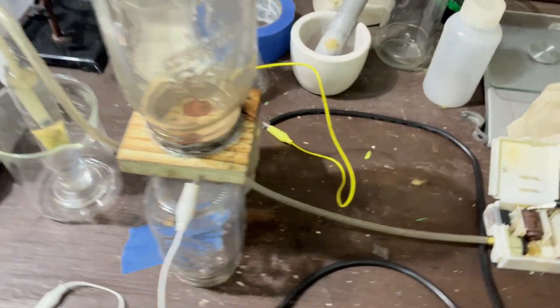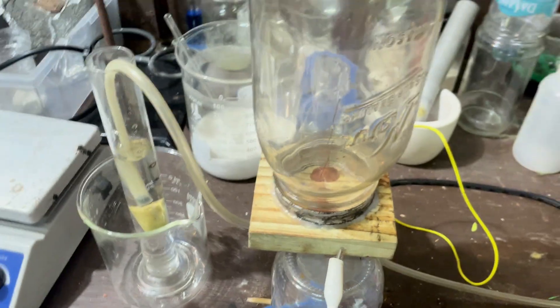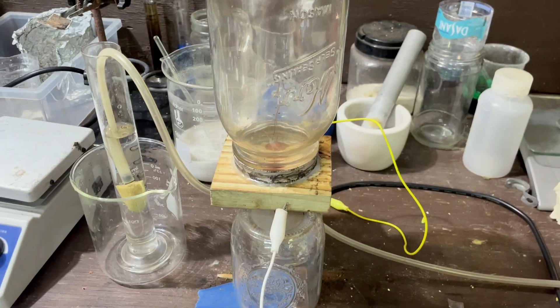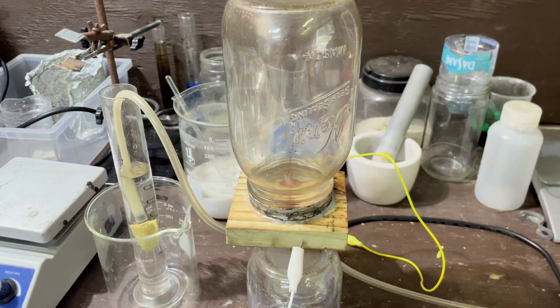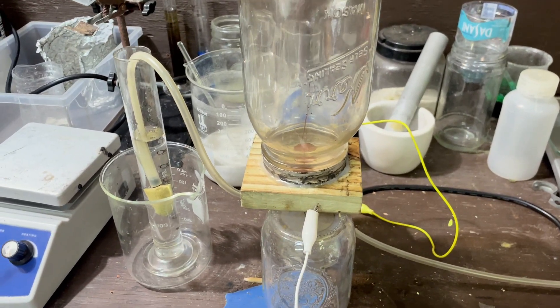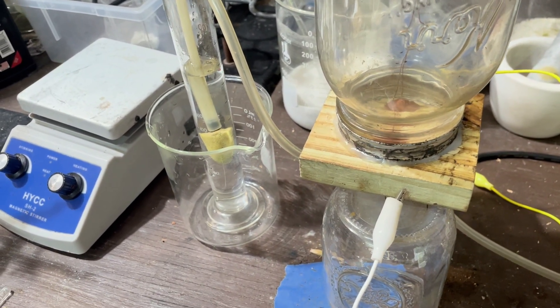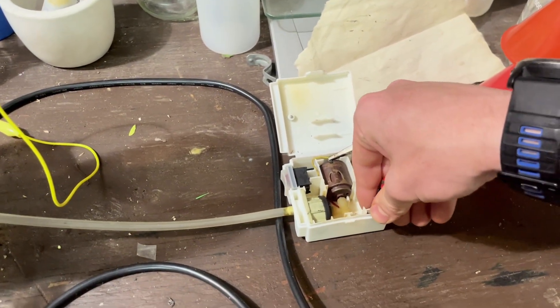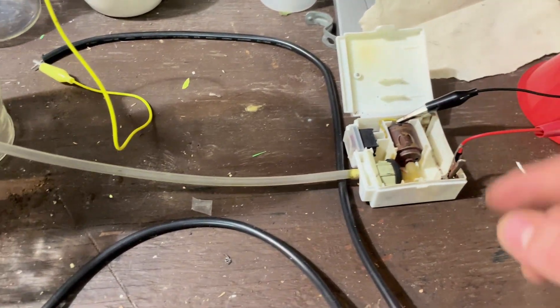Let's turn that off for now. I'm going to put my pump together and hopefully get this running. I'm going to probably run this for an arbitrary amount of time. I'll note down how long it runs and see if I can figure out how much nitric acid it makes per hour. Definitely not going to be great, but it's going to be some way passable, I believe. My pump is not happy. There we go.